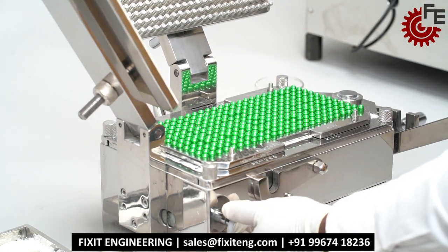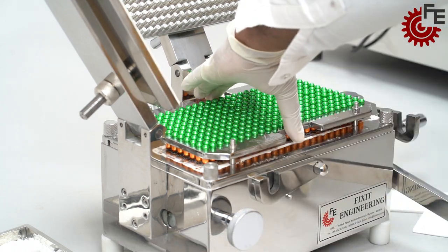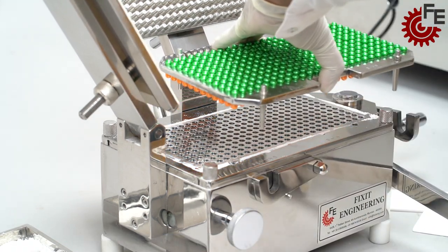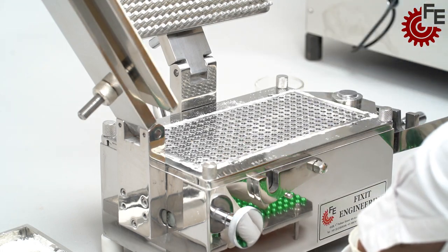Swivel the front knob anti-clockwise and press the lifting lever down to lift the 300 hole capsule tray. Your 300 capsules are ready, filled with powder.